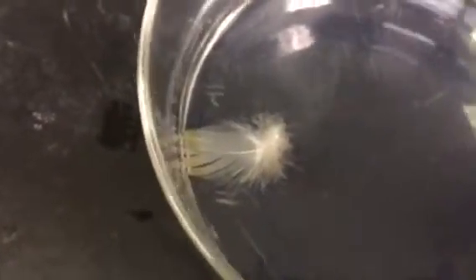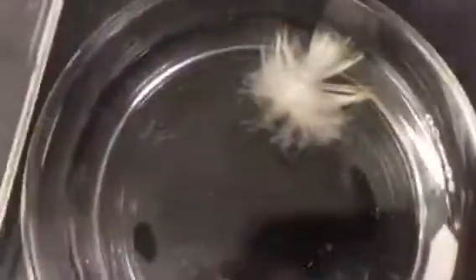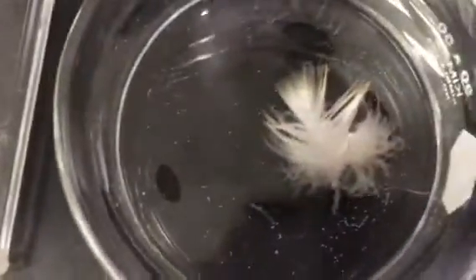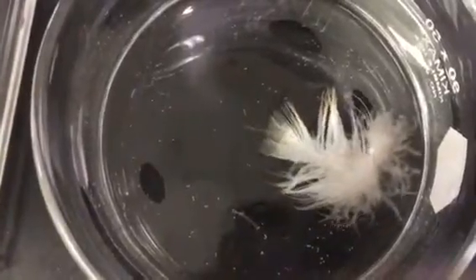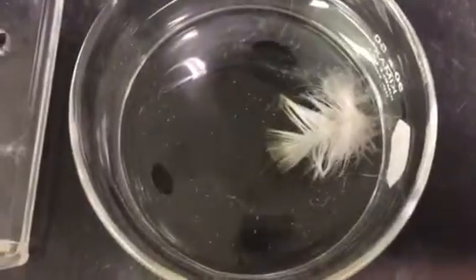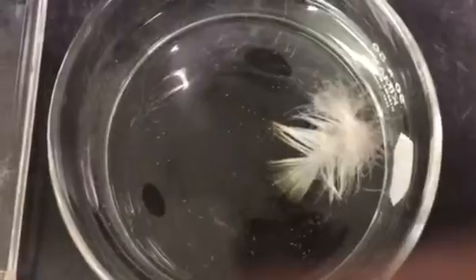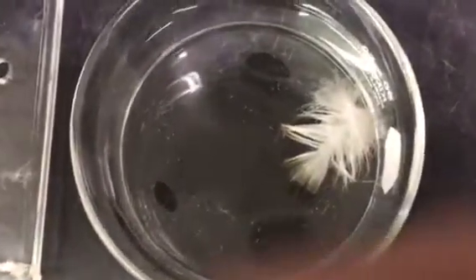On the other hand, if you look at the feather in water, in this case you can see that the feather, and I'm going to prod it a little just so you can actually see it floating easily. The feather's floating easily and it's not at all wet by the water. So PEG 14 oleate is a surfactant that actually enhances the wetting of the feathers of ducks, and that's what we're trying to avoid. What we're trying to do is emulsify the oil without emulsifying the duck.